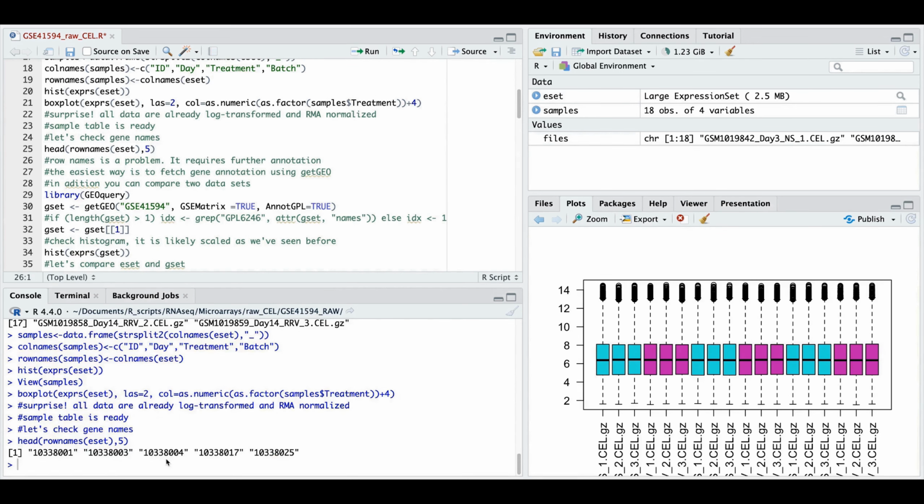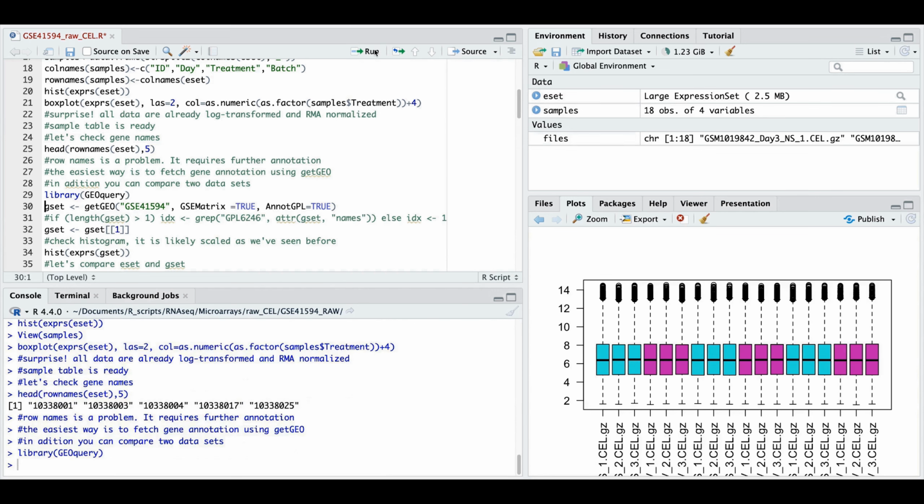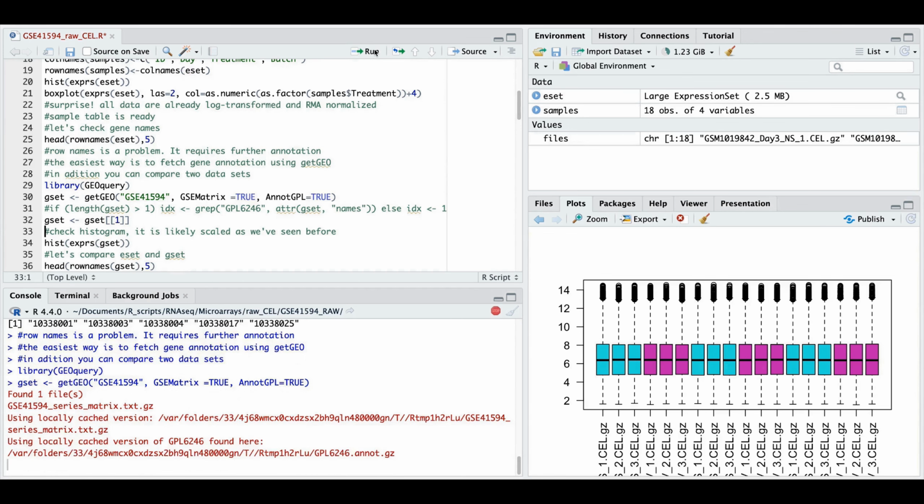Now let's check what else we have to do. We have this problem that gene names are not really gene names, and therefore we need the original data from GEO2R for the proper annotation, and why not for comparison of this data with the scaled data. Therefore we continue with the GEO2R lines. These are from GEO2R.